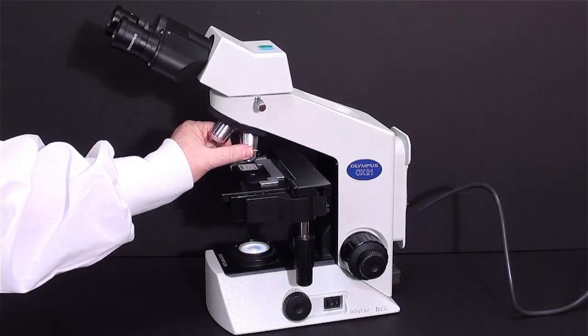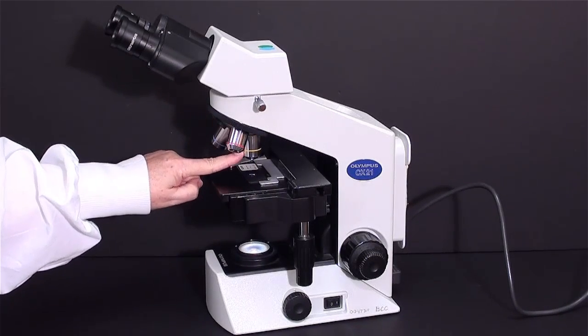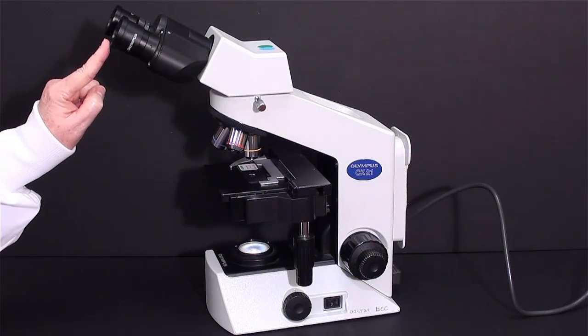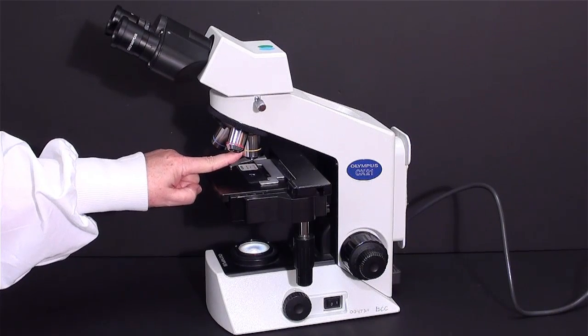The low power lens is a 10x lens. So, the magnification when you're using this is provided 10 from here and 10 from here for a total of 100x.